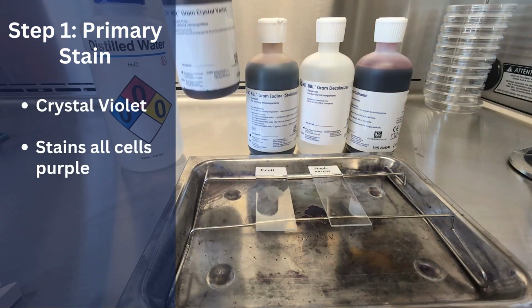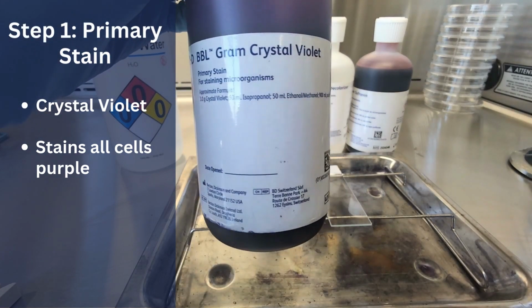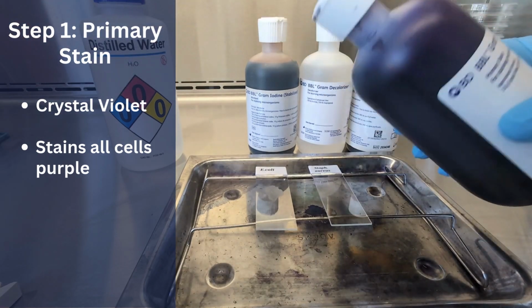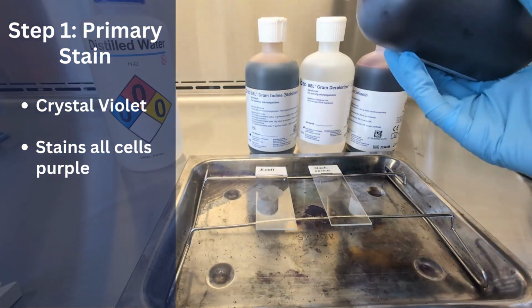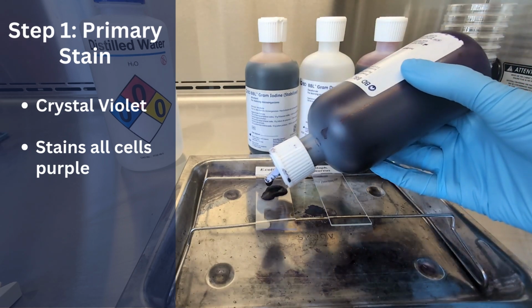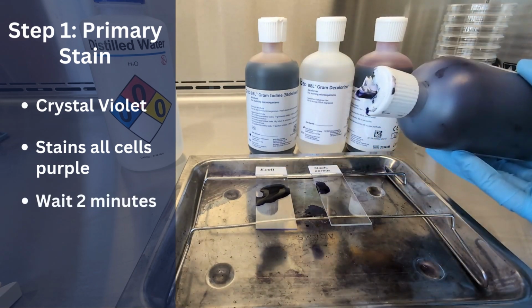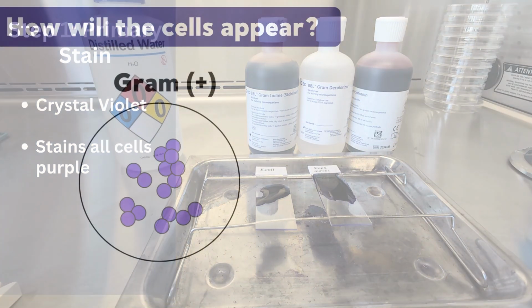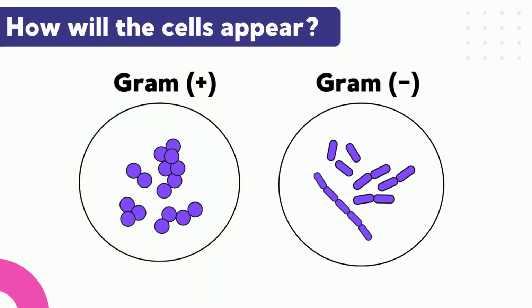The first step is to add crystal violet, the primary stain. This stain covers all the bacterial cells, turning them all purple, no matter what type they are. The stain is left to sit for 2 minutes, so that it can be absorbed by the cells. At this point, both gram-positive and gram-negative bacteria will be purple.